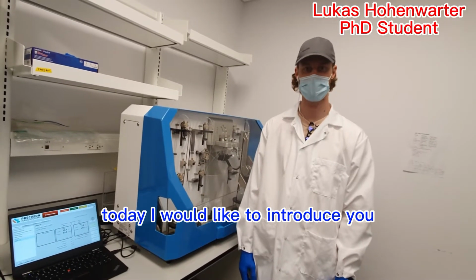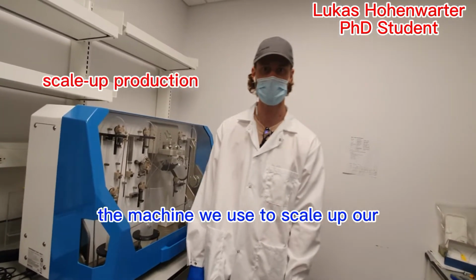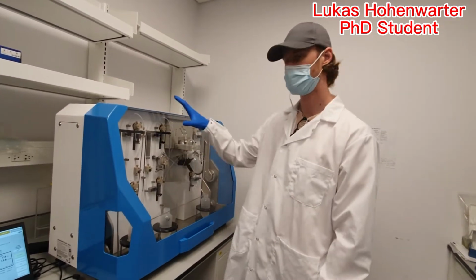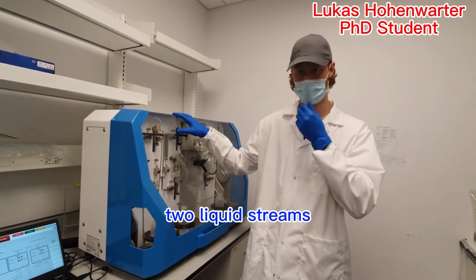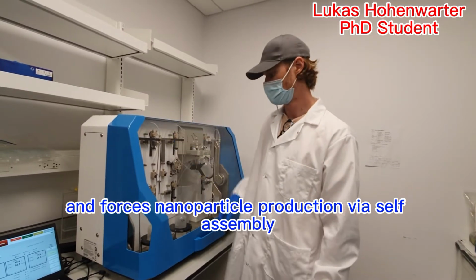Hello everybody, today I would like to introduce you to the NanoAssembler Blaze, the machine we use to scale up our nanoparticle production of formulations that we develop in the Li Lab. This machine uses rapid microfluidic mixing that combines two liquid streams and forces nanoparticle production via self-assembly.